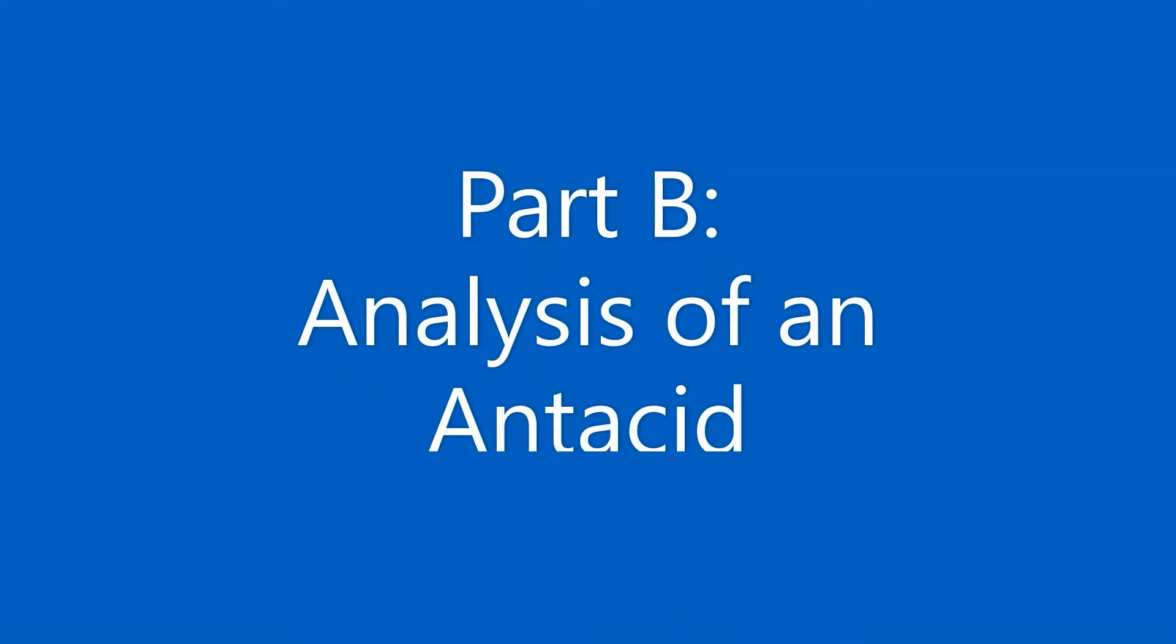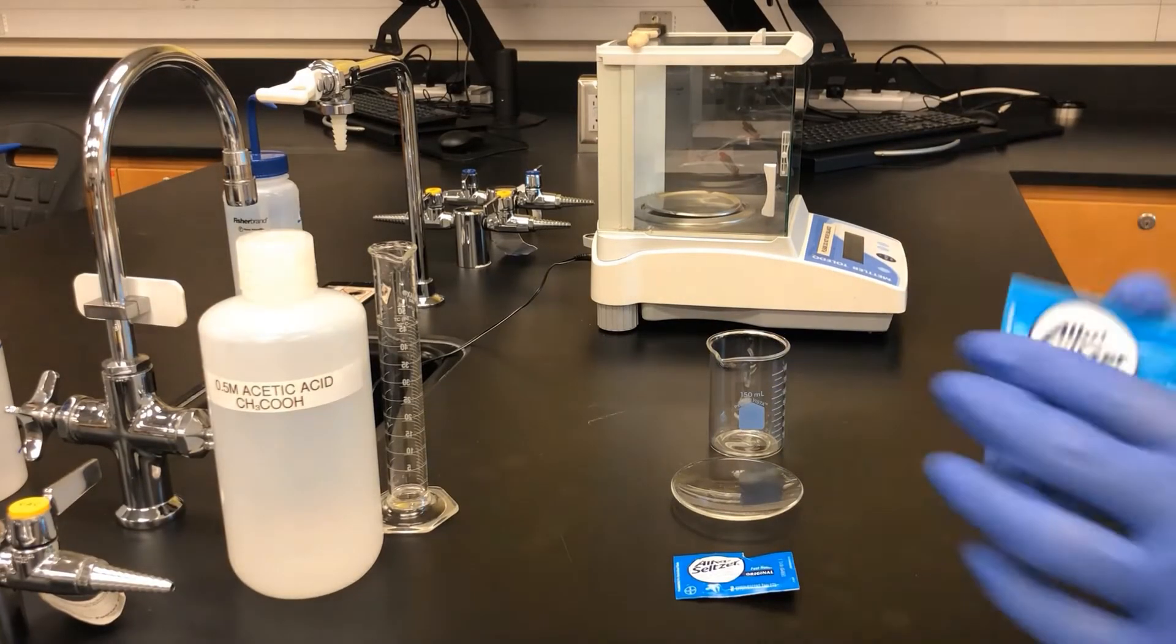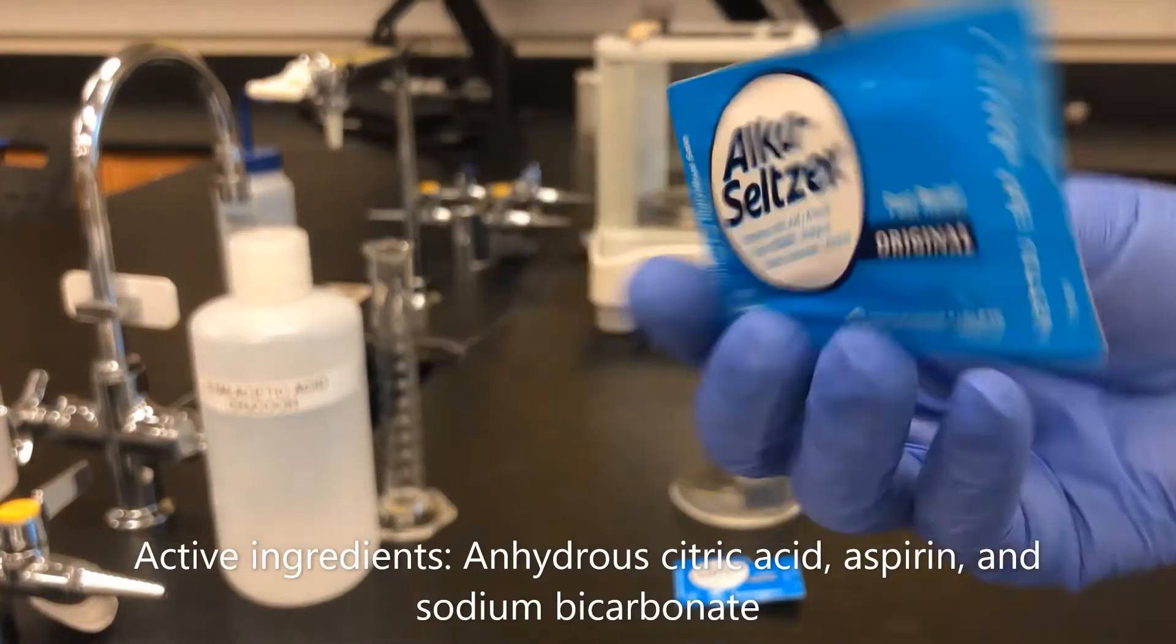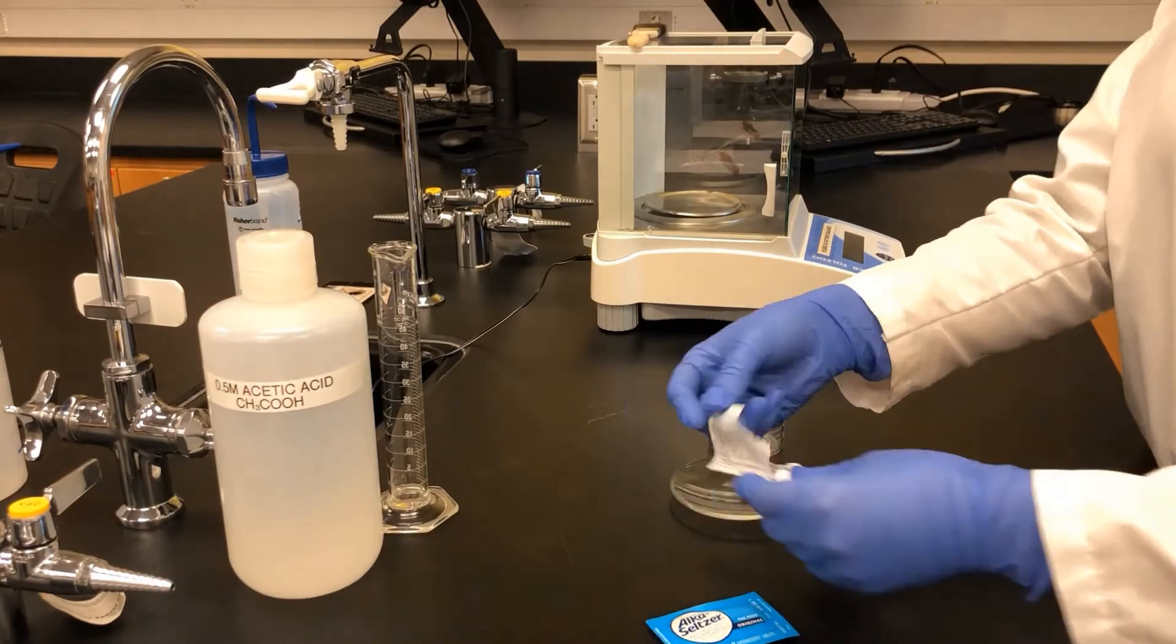This is Part B, analysis of an antacid. Alka-Seltzer tablets contain three active ingredients: anhydrous citric acid, aspirin, and sodium bicarbonate.